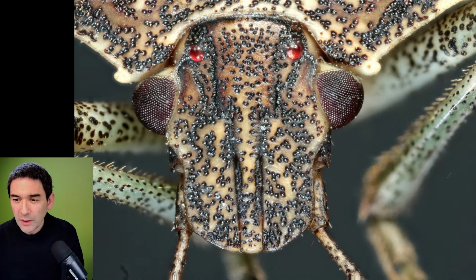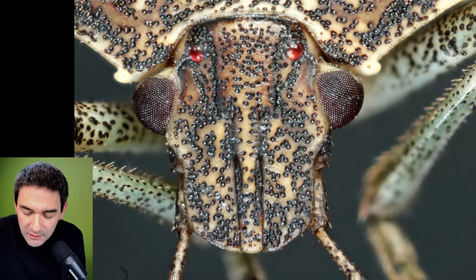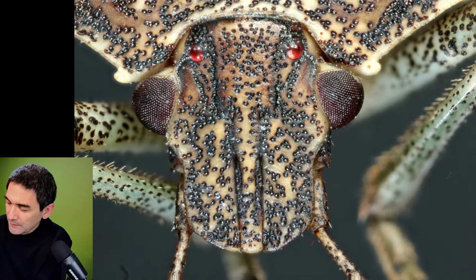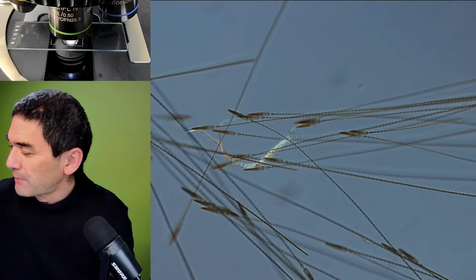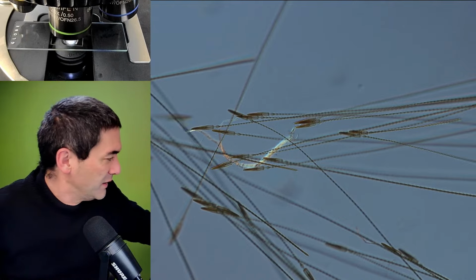Okay, what I want to do now is still checking a little bit my bleeding here, just for the fun of it. Before I show you the other insects, let me quickly show you the following. I'm switching over to the scope view. I need to turn this up here. I'm going to cover the spider again. So I'm going to put the spider away now. If you are afraid of spiders, you can now join in again.